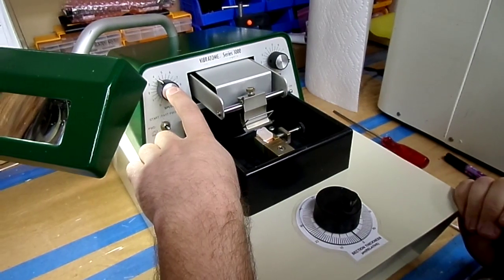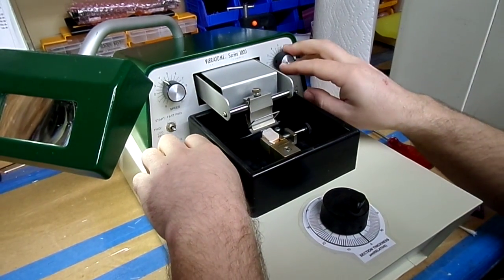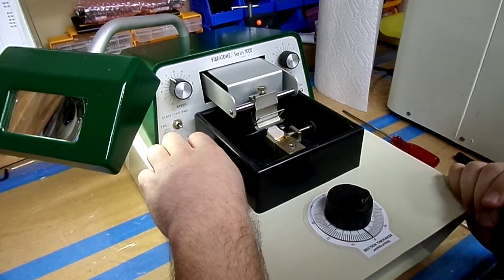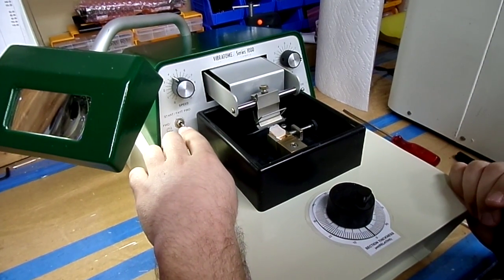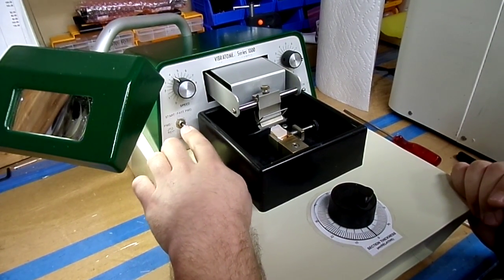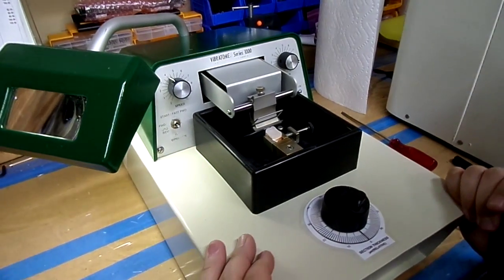We have a speed, keep the speed low, amplitude, I like to, it works on a higher amplitude with the wax. You know, you're going to have different settings for different specimens. And here we go.